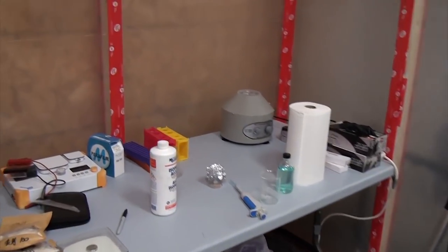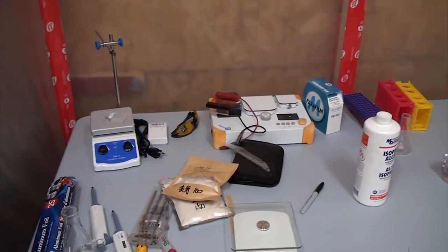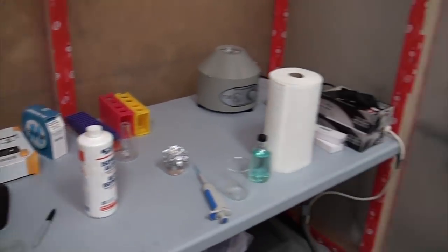With that done, we loaded in a table, some shelves, and a fridge, followed by all the new equipment we'll need to do lab work. But we'll be going over all of that in future videos.